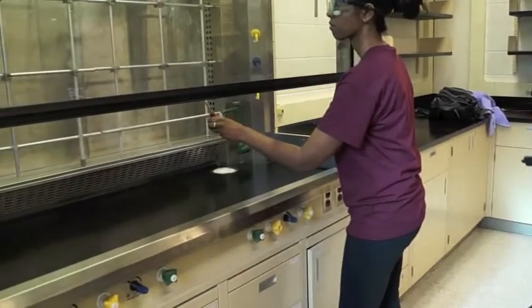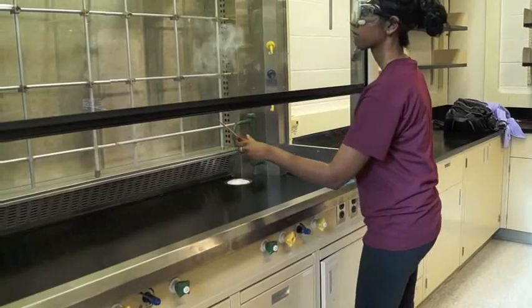The pencil is placed at different positions — left, center, and right — each six inches from the hood face. Only the smoke pencil test provides results that show a hood's containment ability.